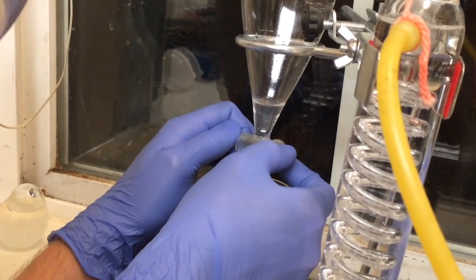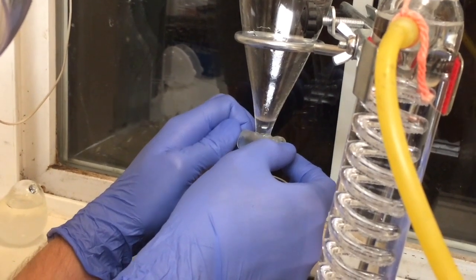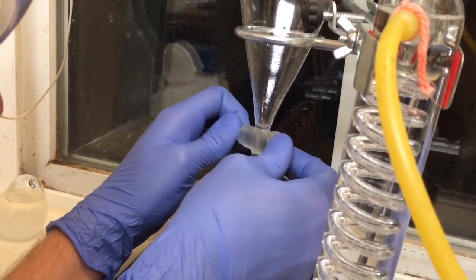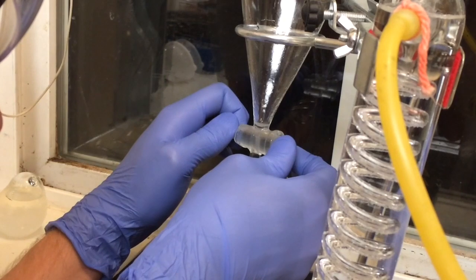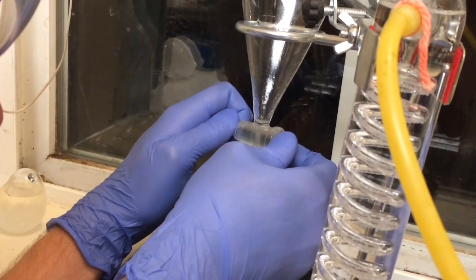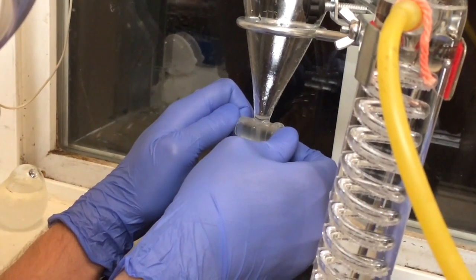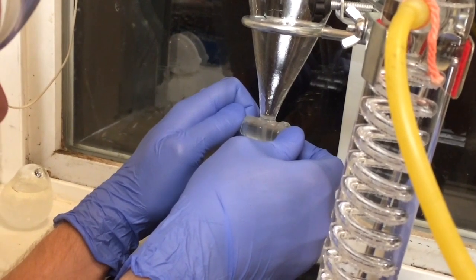We can repeat this process several times in order to get the most oil. So at this point you want to go very slow. We're just getting it down at the very end before it goes through and then we'll cap it off.